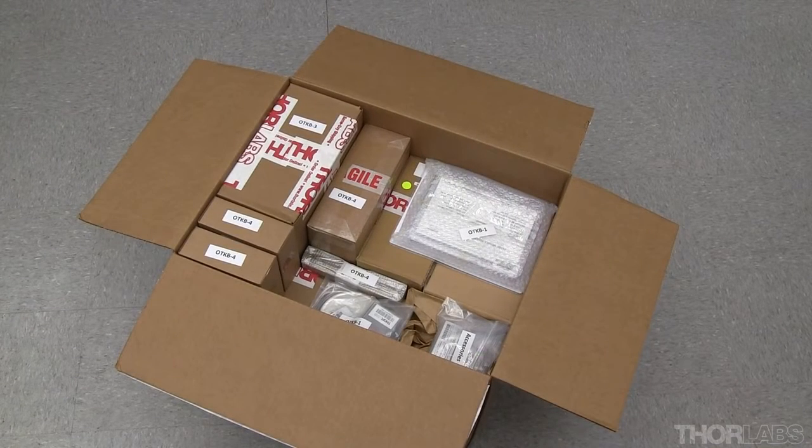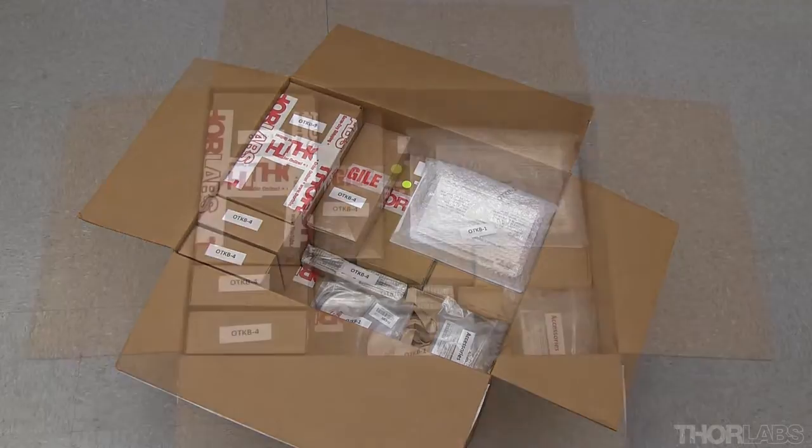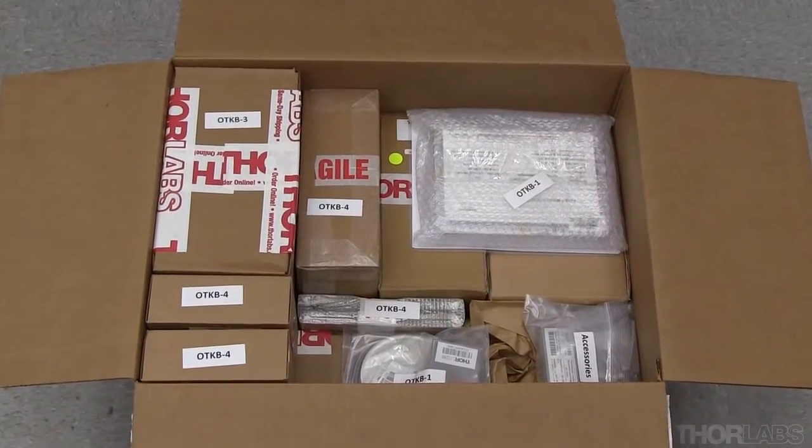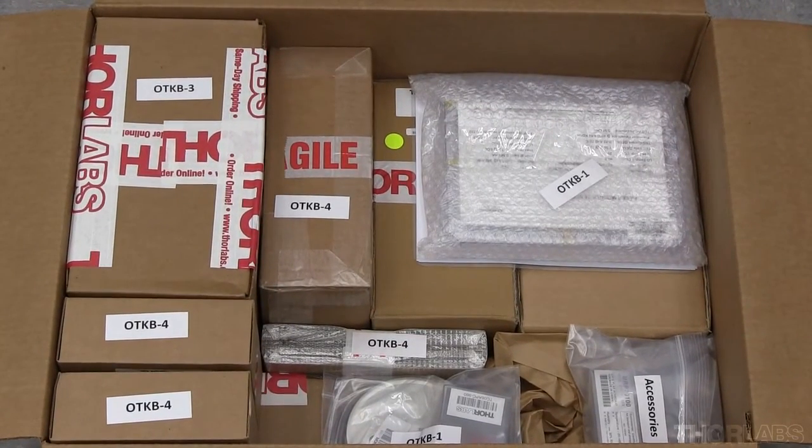In this video, we will unpack and install an OTKB system. The OTKB is broken down into several modules for shipping purposes. Be sure to inspect the parts and compare the contents to the packing list.